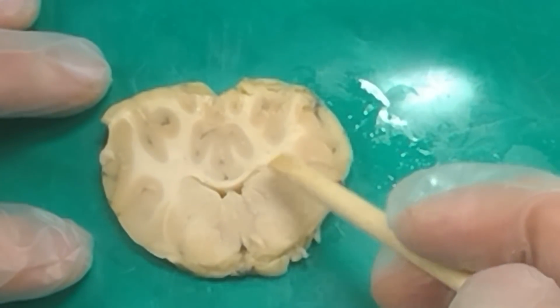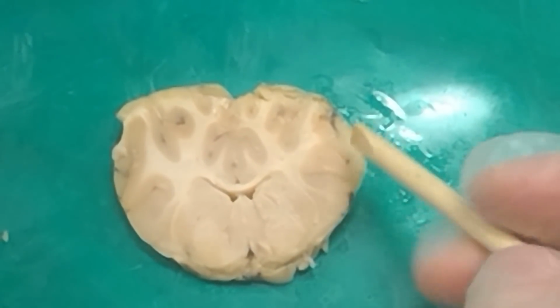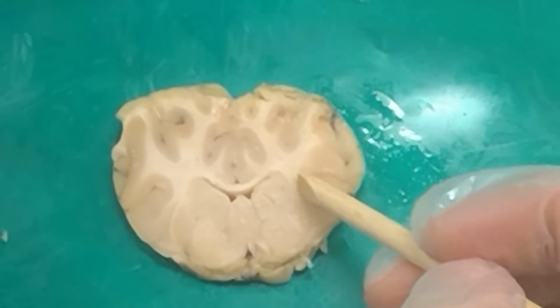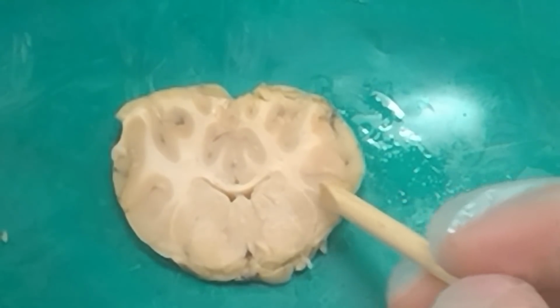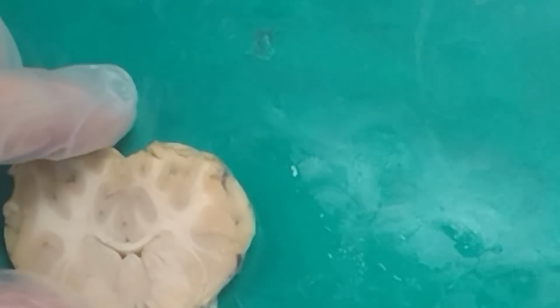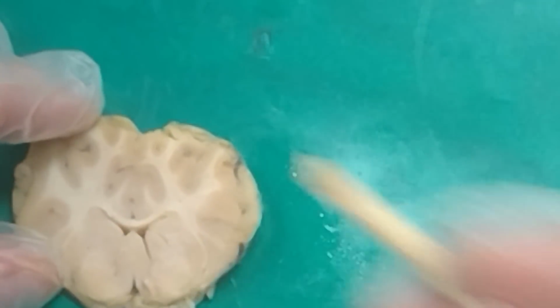Aren't we getting sick of corpus callosum? And I love my corpus callosum. All right, so then these fibers again on this side of the putamen. External capsule. And the other one's over here. Extreme. And then this triangle right here. Claustrum again. And now the septum is this large piece right here, if you're wondering.